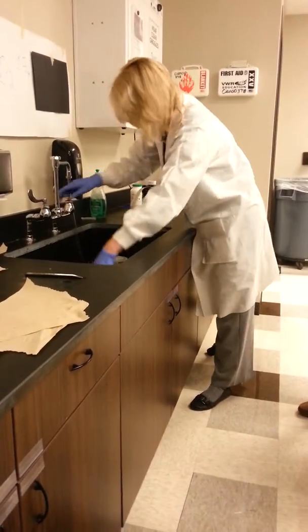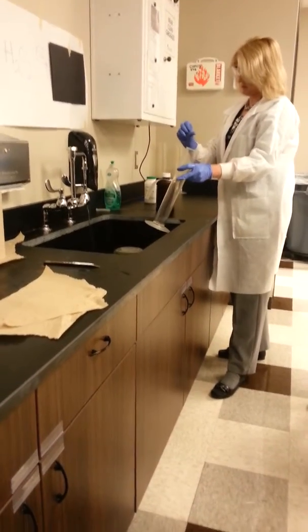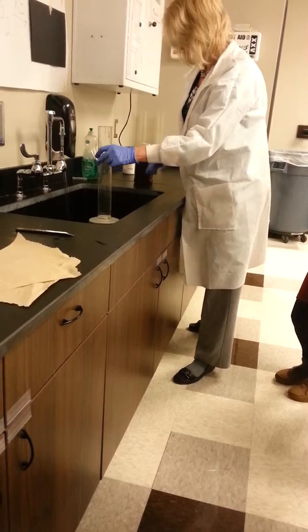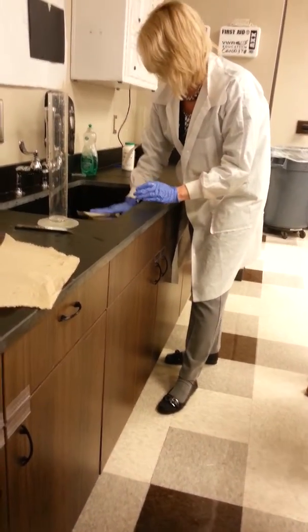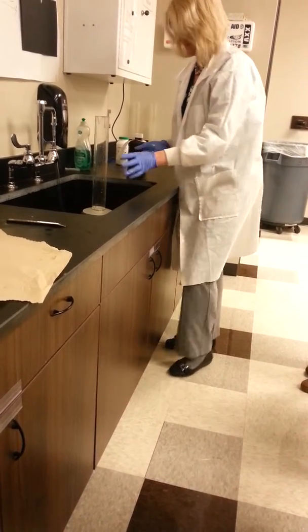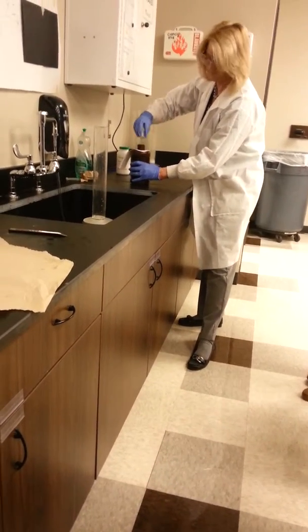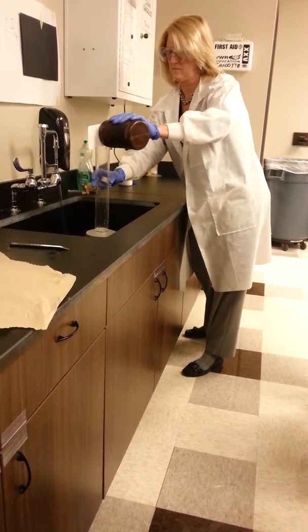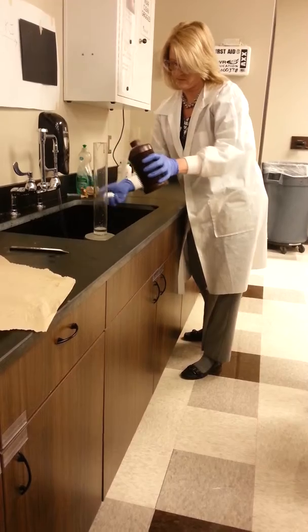Ooh. We're going to pour that down the sink with lots of water and try again. I'm going to get new gloves too. Slippery here today. Okay, try this again. There we go.